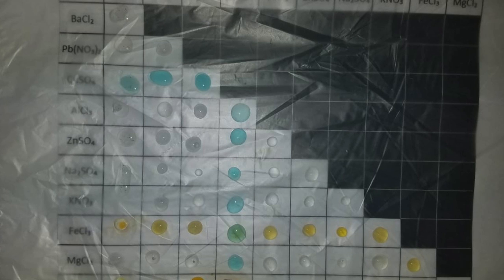For practice number 7, we were able to observe how certain reactions precipitated, while others didn't. This depended on their level of solubility, like nitrates, which are all soluble in water, and therefore they don't precipitate.